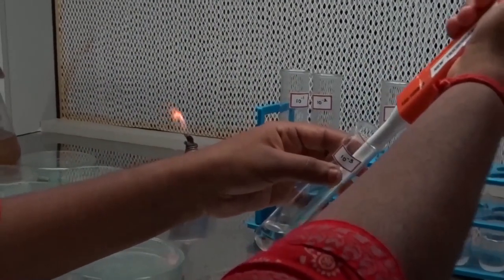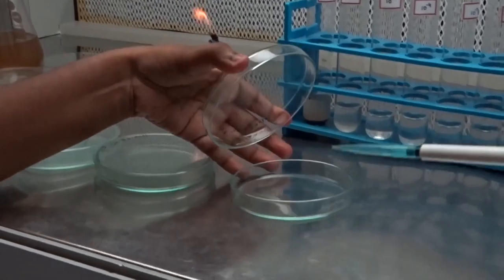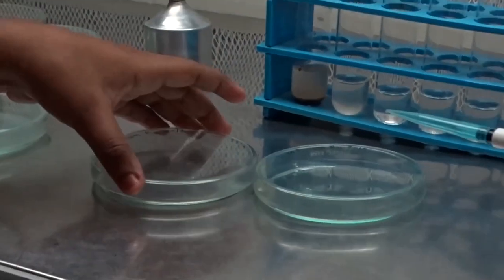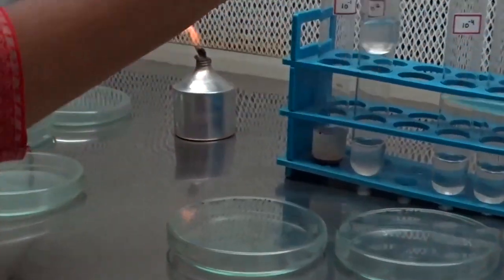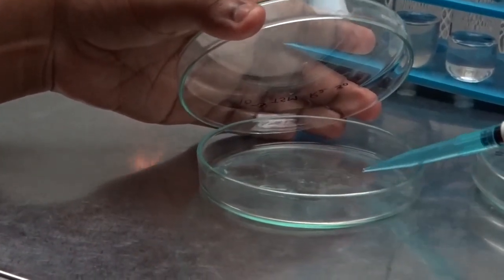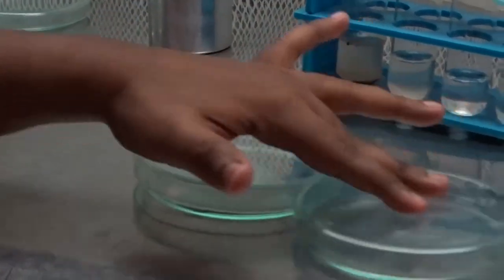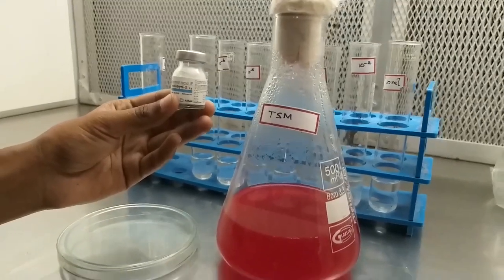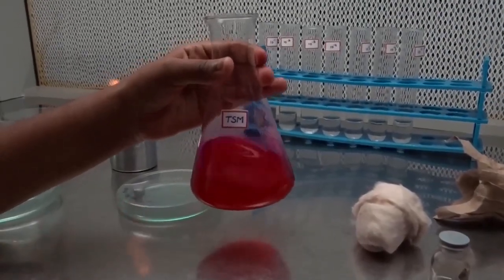Choose 10 to the power minus 3 dilution for isolation of fungi Trichoderma. Transfer 1 ml of suspension to a sterile petri plate and rotate the plates gently.